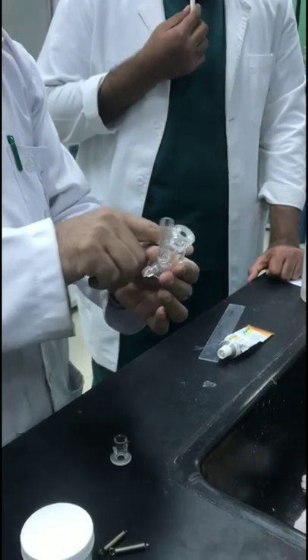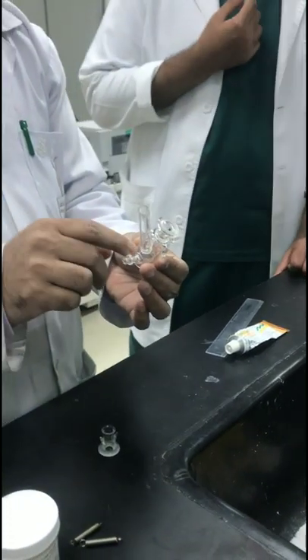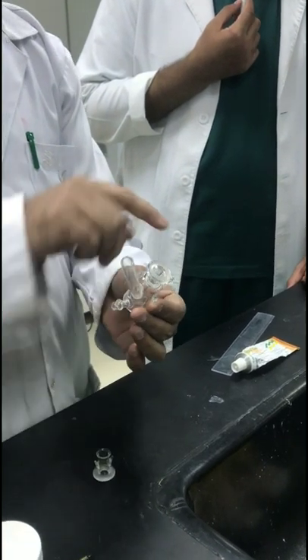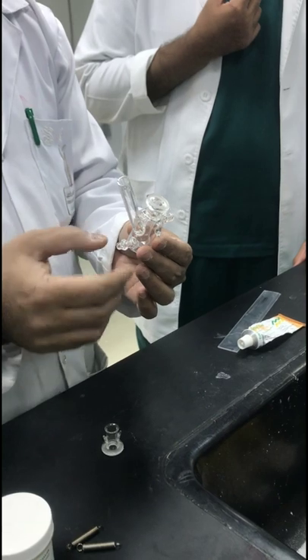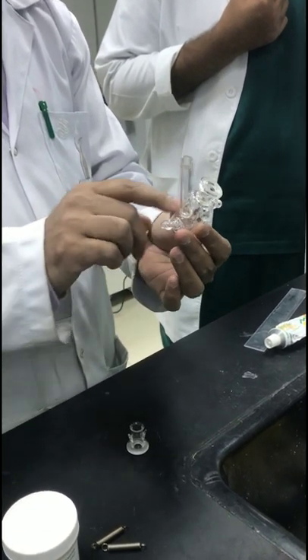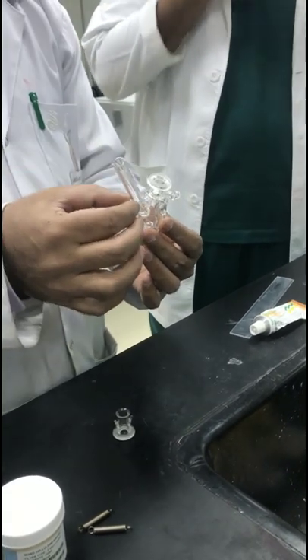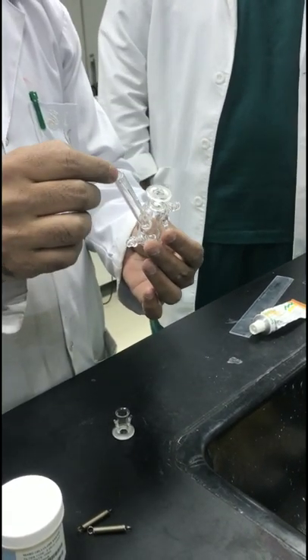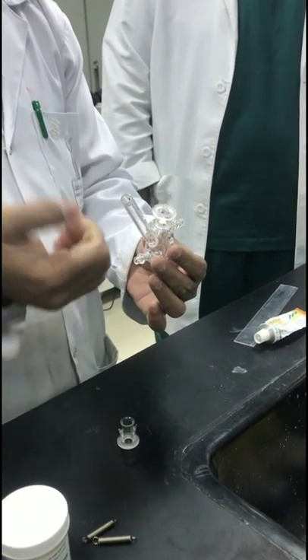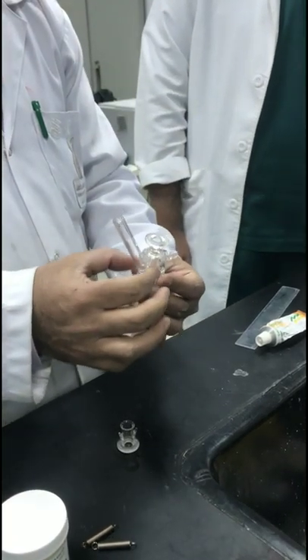You will see here the inlet and outlet — this is for the water jacket. You can put hot water in from one side and it circulates to maintain heating at 32 or 37 degrees centigrade. The outer jacket is for heating only.